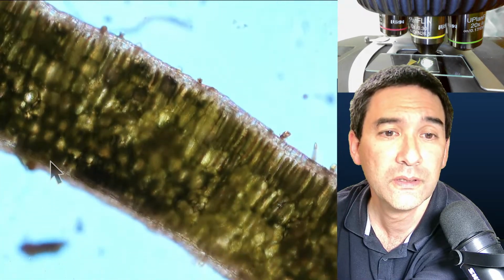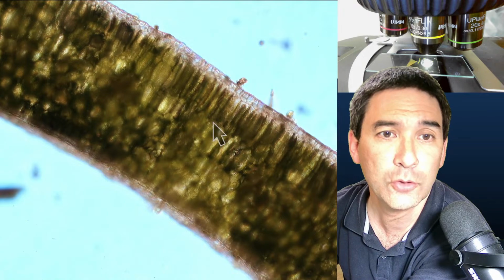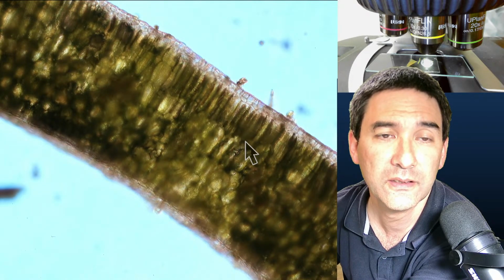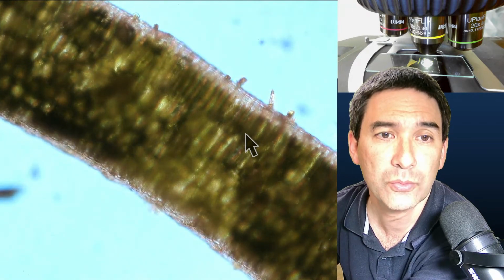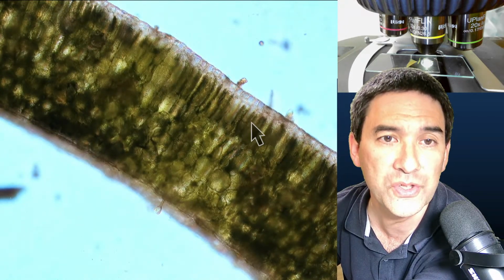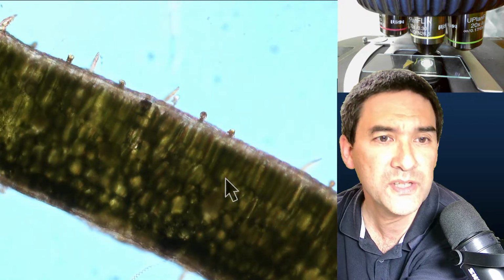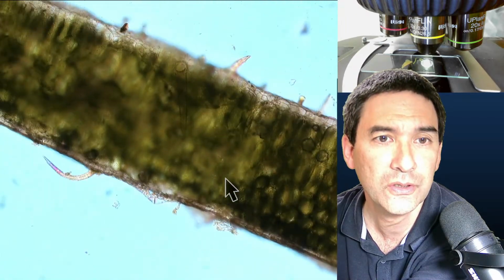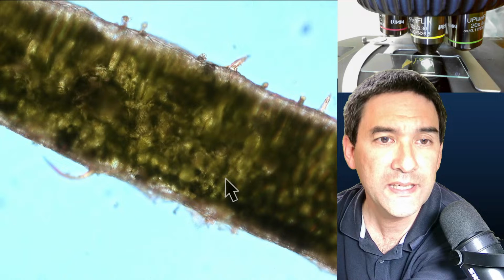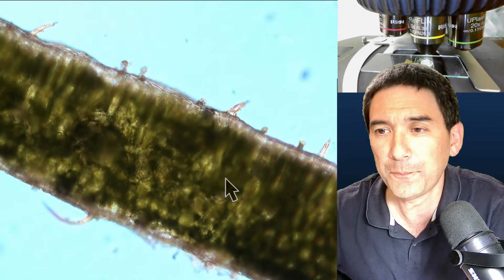So now let's have a look at another one over here. Here you can see it quite nicely, the top layer of the leaf with the cells. And if you actually focus through it, you can see that maybe there are only 2 cell layers. One cell layer goes out of focus, the other one goes in focus. And over here, I think that's the third one. This one seems to be a little bit thicker already because it's darker. So that is essentially the direct leaf under the microscope.